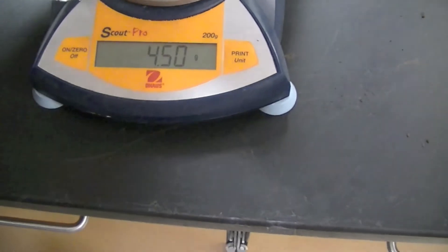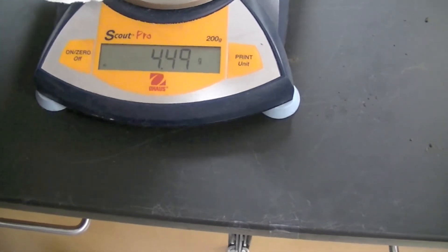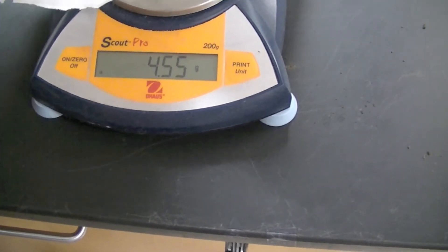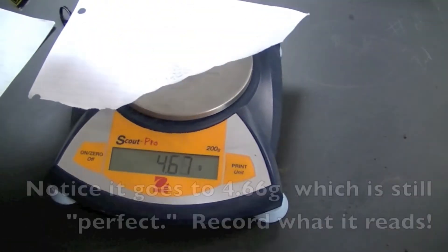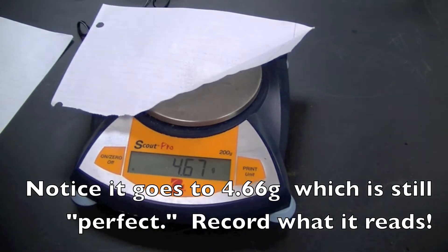Remember, our magic number is 4.67. There we go, that's perfect.